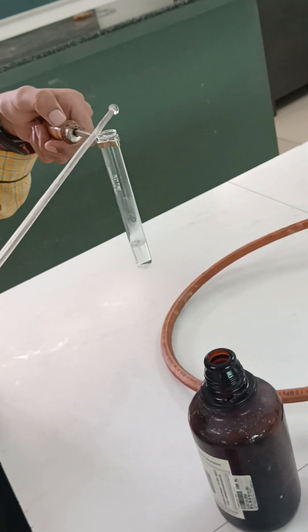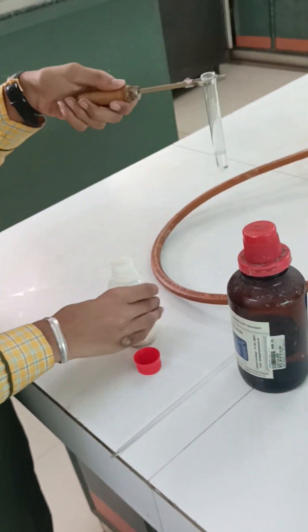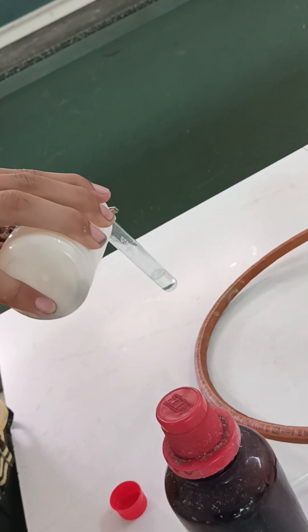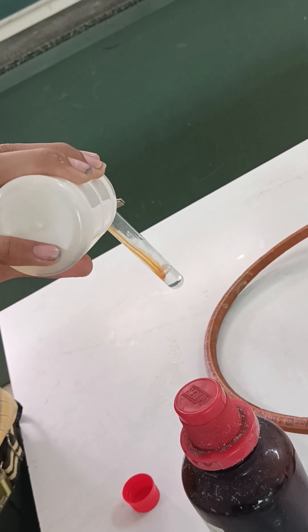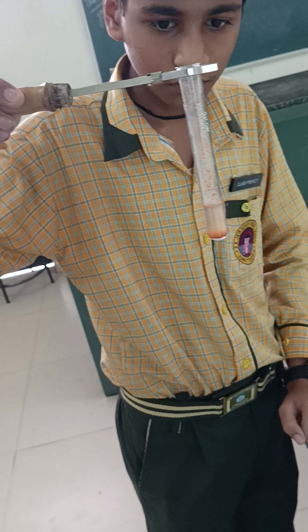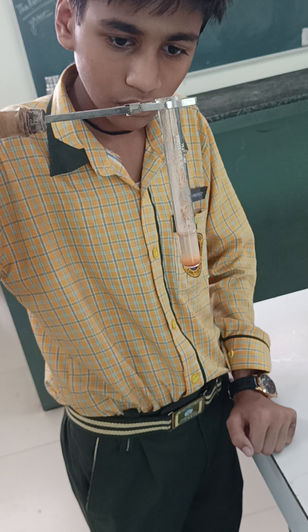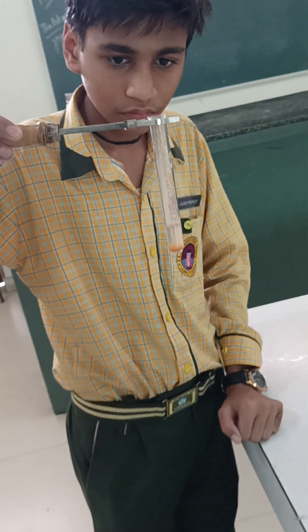Now we add Nessler's reagent, whose formula is K₂HgI₄. The formation of a brown precipitate is the confirmatory test for the detection of ammonium ion. This Nessler's reagent reacts with the ammonia gas and we get the brown precipitate. That is all about the zero group.